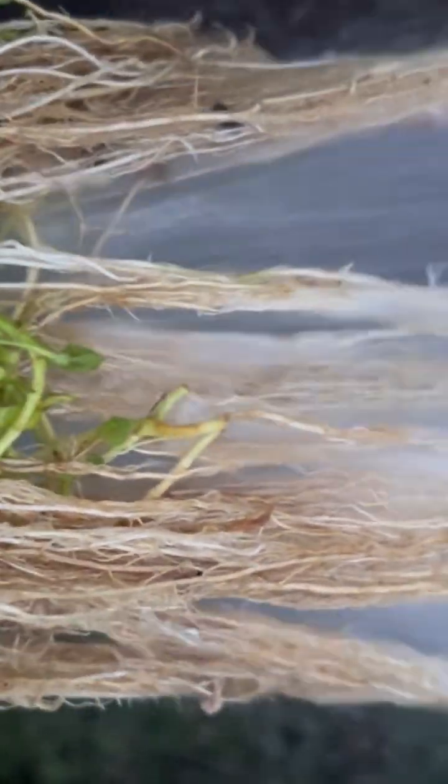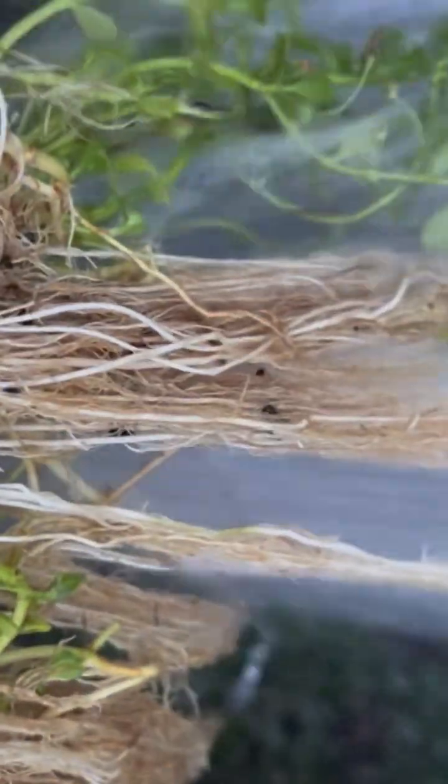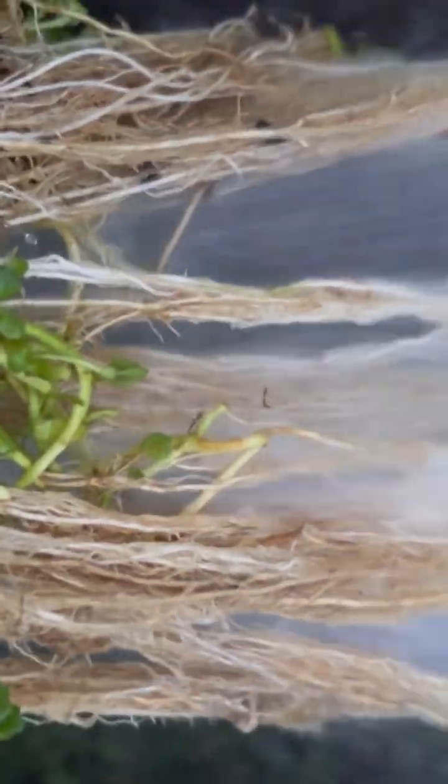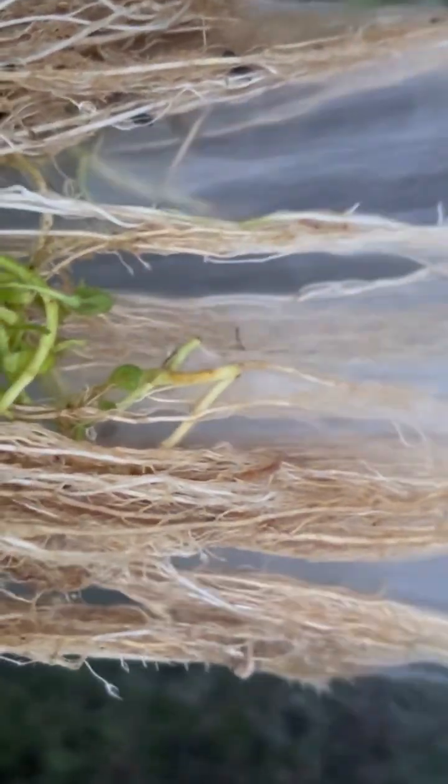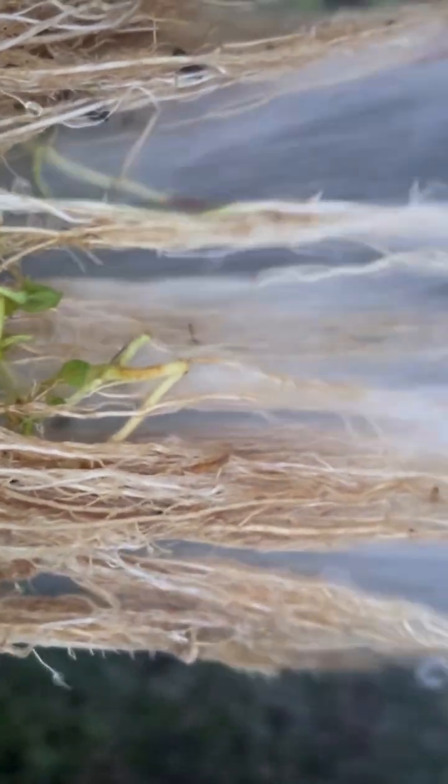You don't want any cross-contamination from anything that might be in the soil, or indeed anything that might be in the dehydrator at the same time as you're dehydrating the sample. And even the sample is laid out on clean paper to dehydrate so that it doesn't pick up anything from the screen.